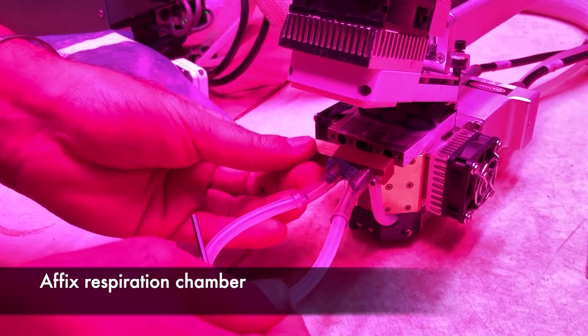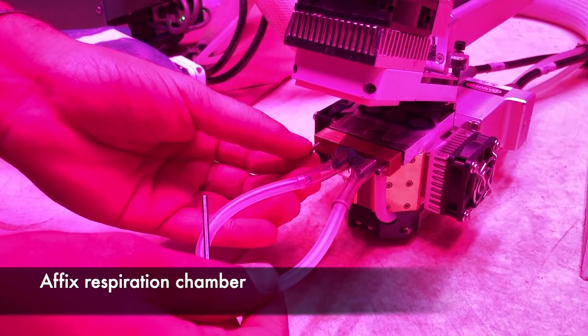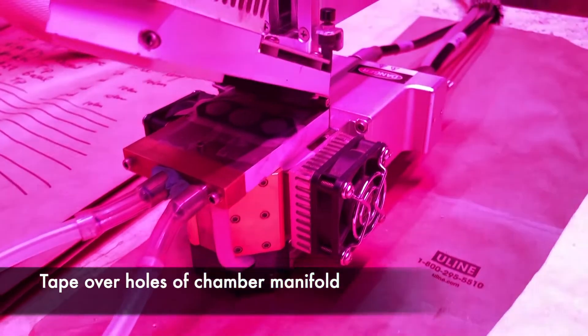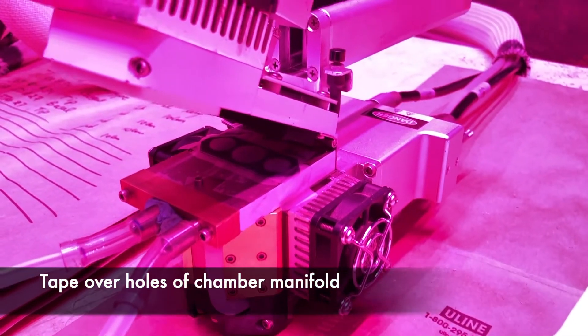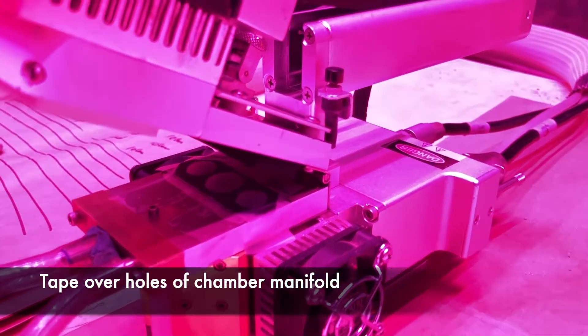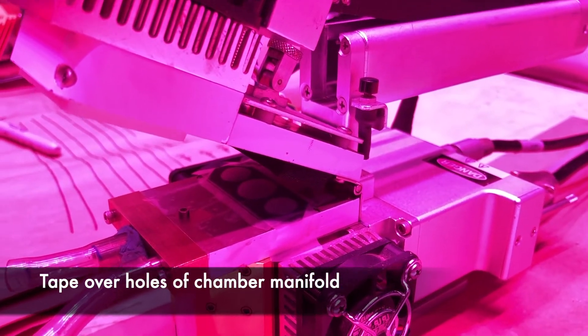We apply adhesive tape over the three holes in the chamber manifold to seal them. Please note that the size of the chamber will affect the sensitivity of the measurement, where it may be difficult to detect respiration from a small amount of tissue in a very large chamber volume.